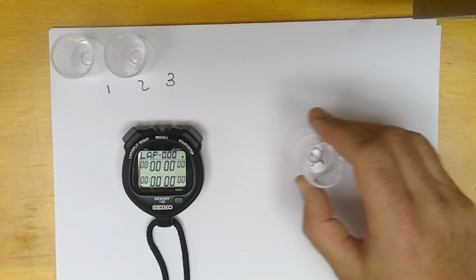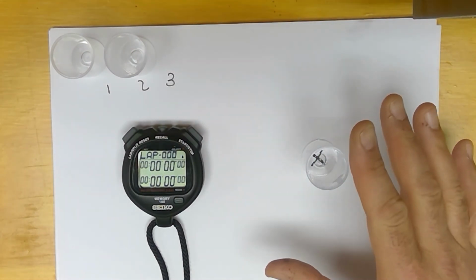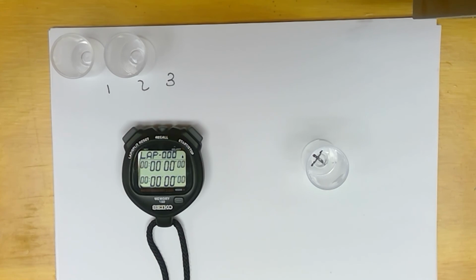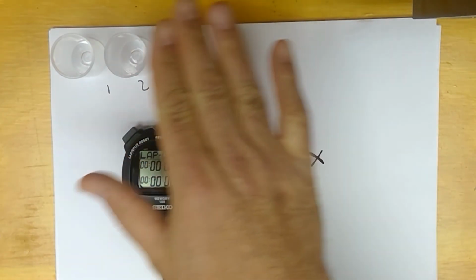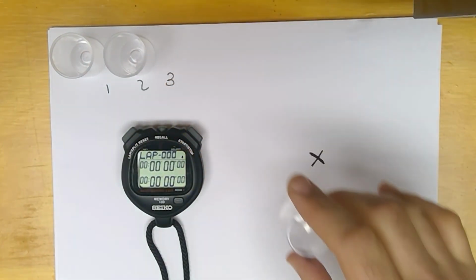So what we're going to do is our reaction in here. We'll put the reactants in there. We'll start it, and eventually it'll get to the point where we can't see the X, and that's where we're going to stop it. We're going to vary the concentration of the hydrochloric acid first. So in the lab we need to fill this with the hydrochloric first, and we're going to change the concentrations of the hydrochloric. You do the most dilute one first.